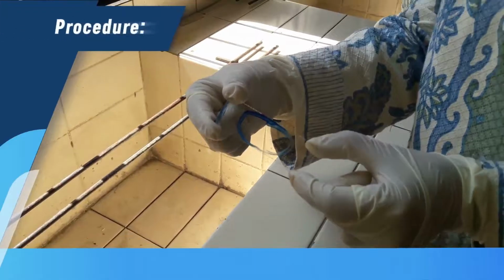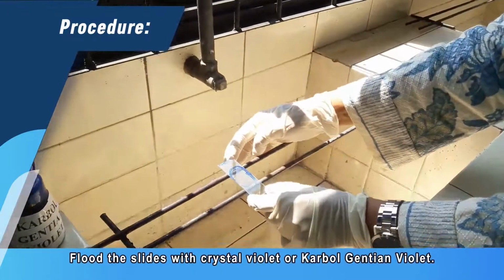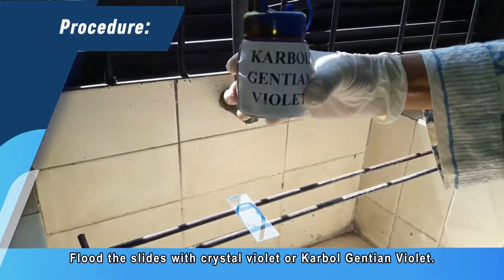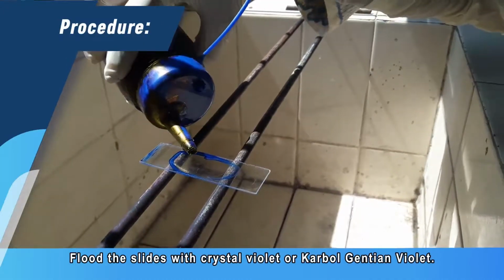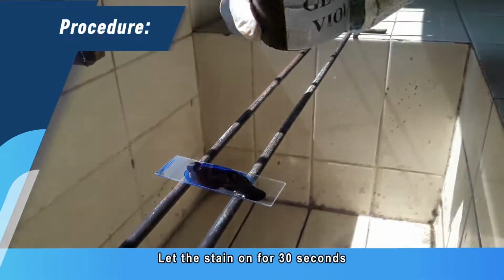Procedure. Place the glass slide on the staining rack. Flood the slide with crystal violet or carbol-gentian violet. Be sure to fill the entire smear with the dye. Because the purple stain imparts its color to all cells, it is referred to as a primary stain. Let the stain sit for 30 seconds.